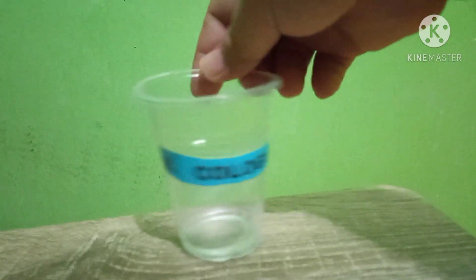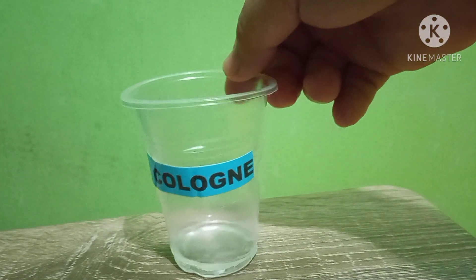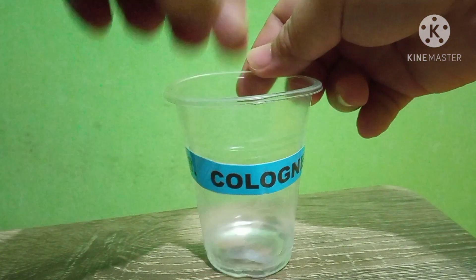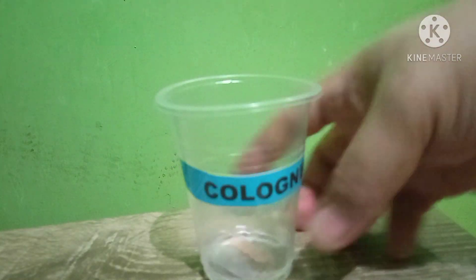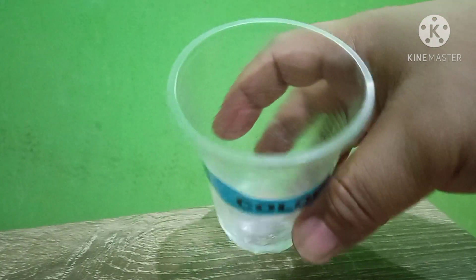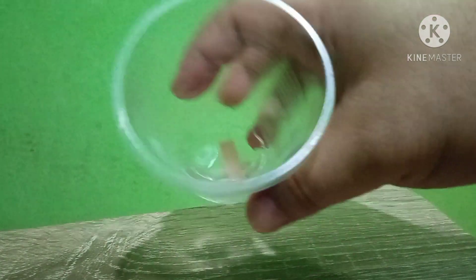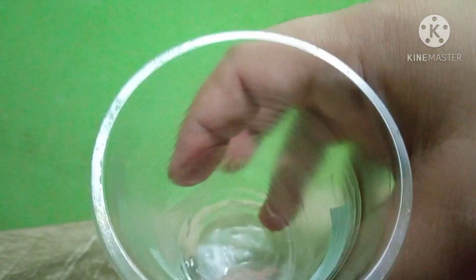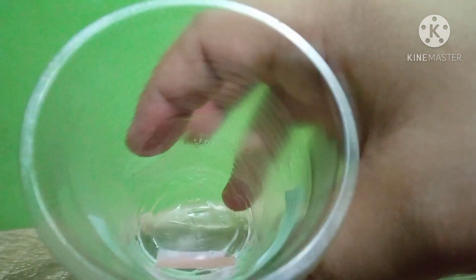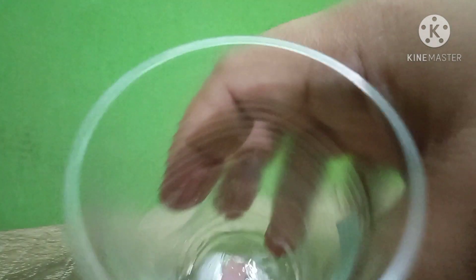Number eight is Cologne. Let's dip the litmus papers. The red one is gradually turning blue in the cologne — slowly turning blue. So cologne is basic.